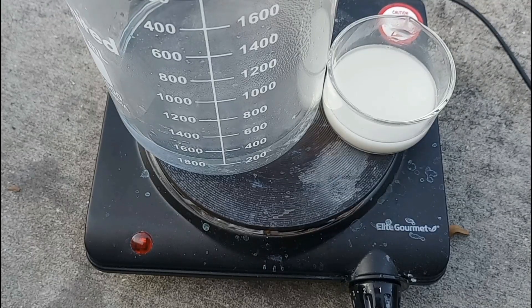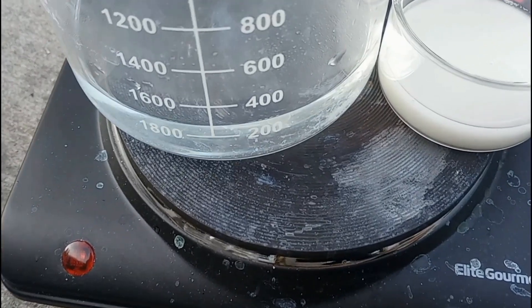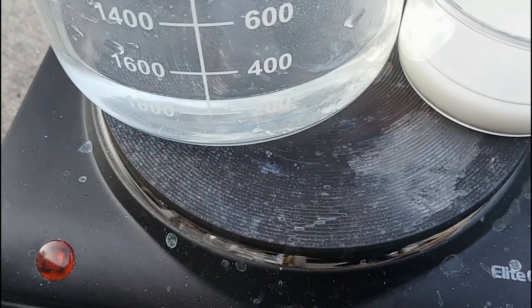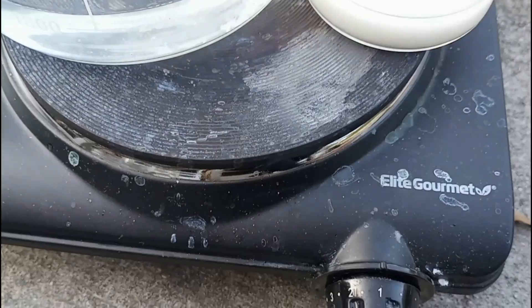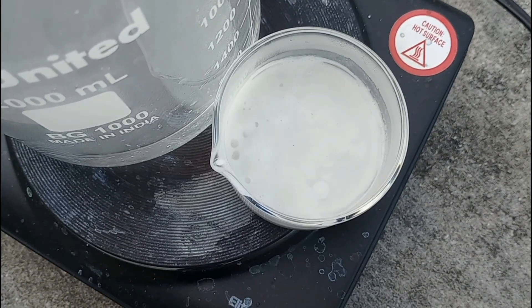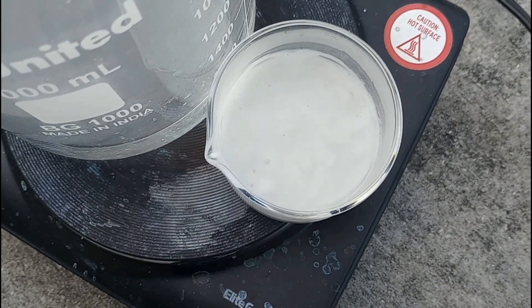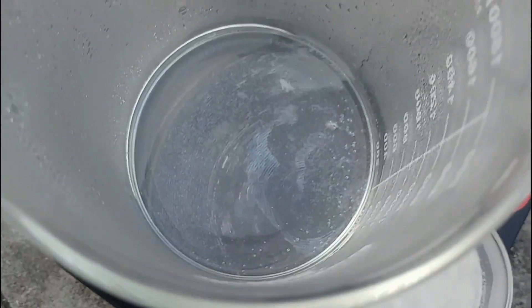Again, the super scientific hot plate is getting double duty. It's trying to reduce the zinc acetate and dehydrate the zinc oxide at the same time. I thought this was interesting to film. I hope you find it interesting as well.